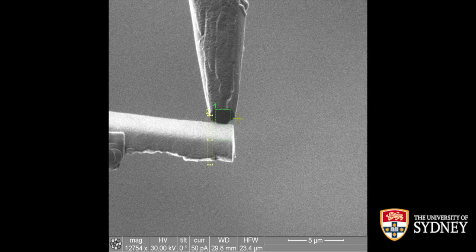So the most basic thing about the deposition conditions is, where does my gas injection system come from? In this case, this is our FEI Quanta. It comes from the right side, which means that the green box, which is the deposition, we will set the scanning conditions from left to right. So from away from the gas injection system towards the gas injection system.